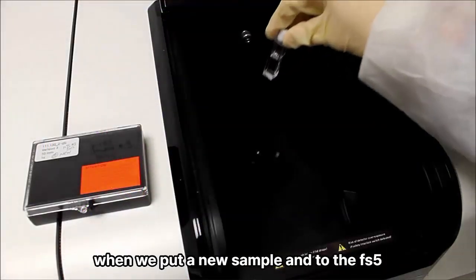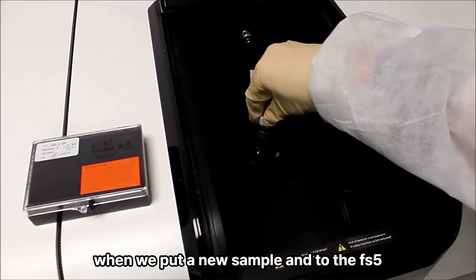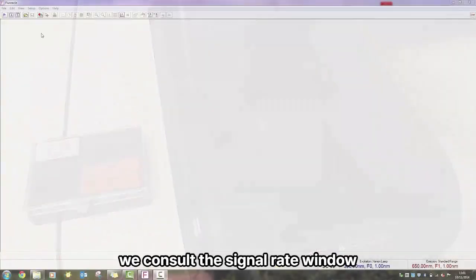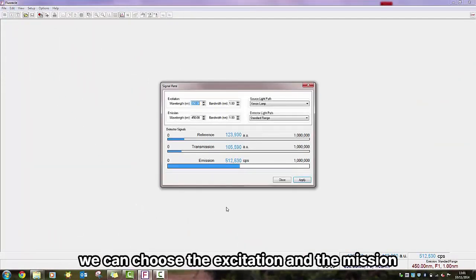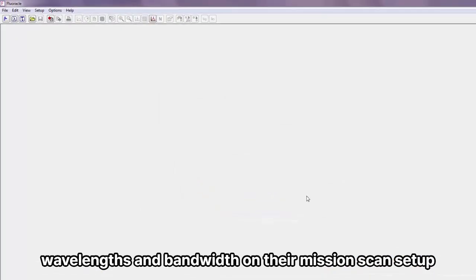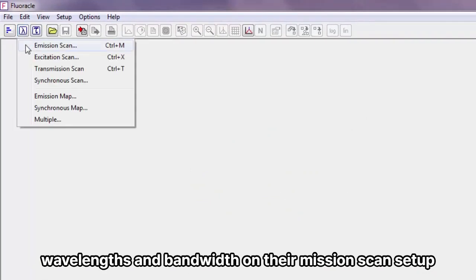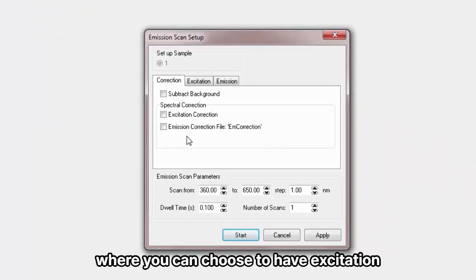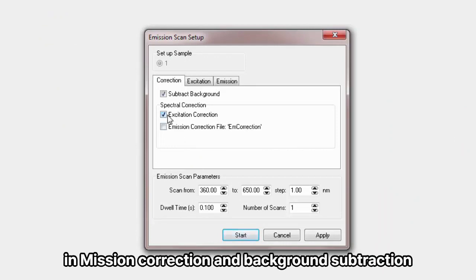When we put a new sample into the FS5, we consult the signal rate window. We can choose the excitation and emission wavelengths and bandwidths. On the emission scan setup, you have a correction tab where you can choose to have excitation, emission correction, and background subtraction.